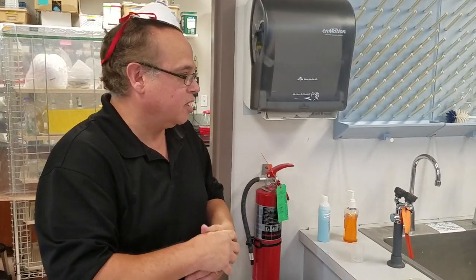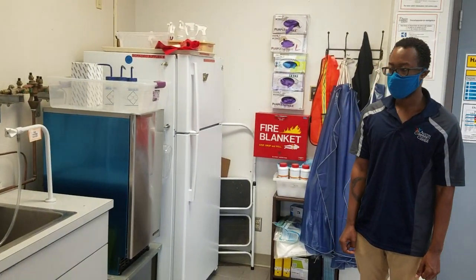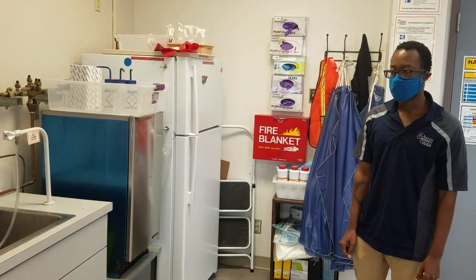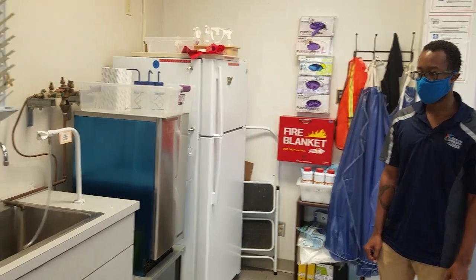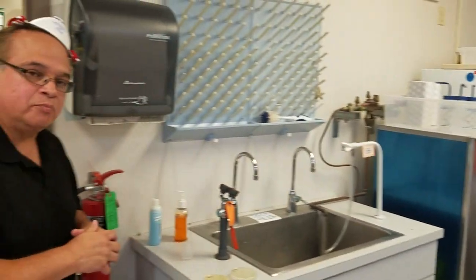For the last treatment — treatment D — this incorporates using soap and water followed by hand sanitizer. This is the way hand sanitizer was designed to be used at my company and a bunch of others I've worked for. Our colleague Anthony is going to make an impression of his hands prior to the treatment. Then I'll turn the water on, put some soap in his hands, and he'll wash. Once his hands are dry, we'll put the hand sanitizer in and he'll rub his hands until the alcohol has dissipated, and then he'll make the last impression.